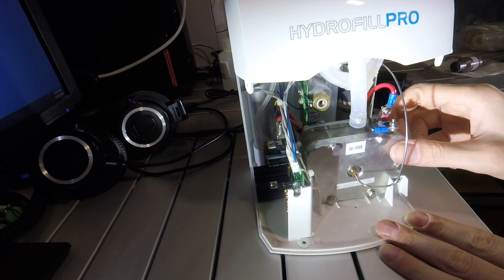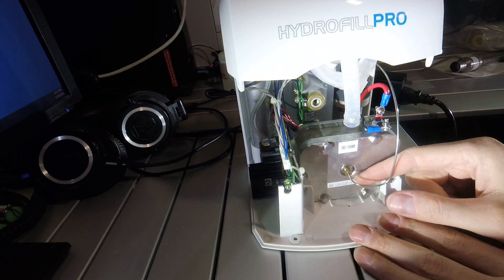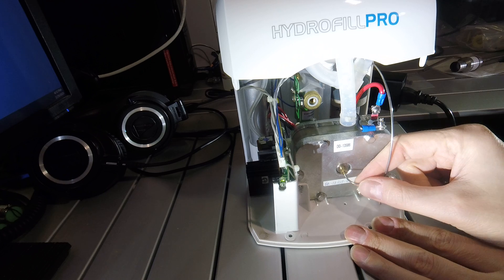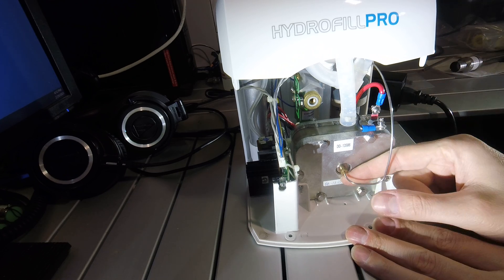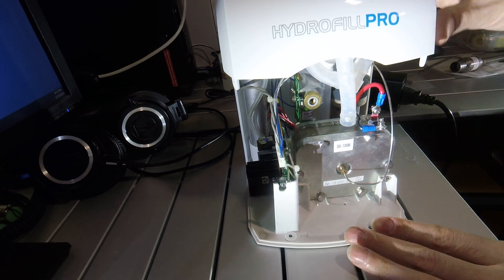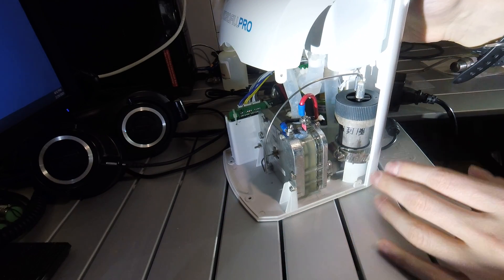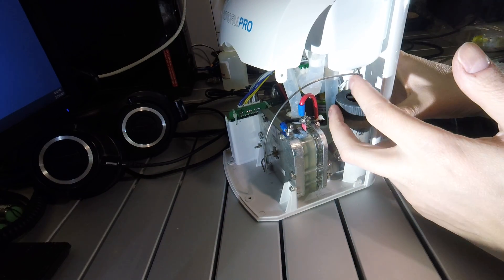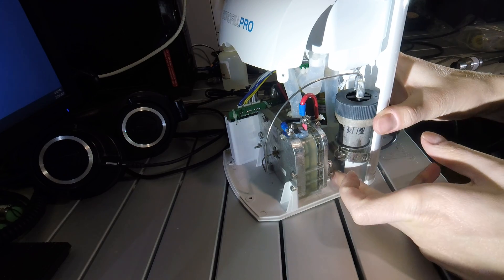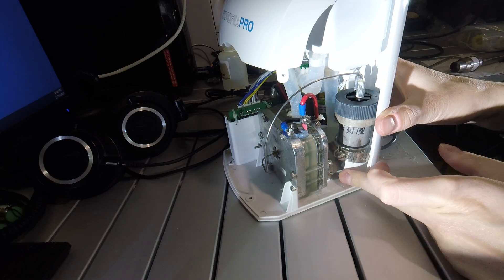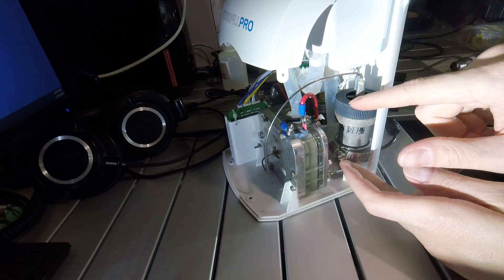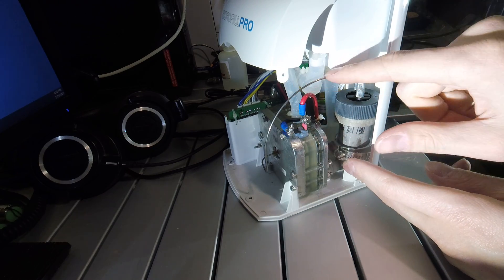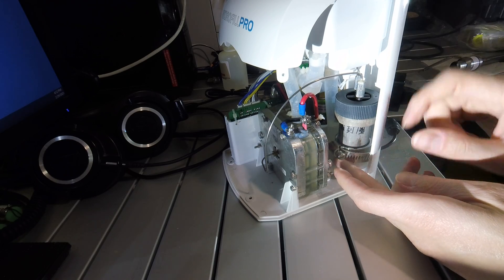So on the hydrogen side of the fuel cell, there is just a small narrow 16th inch OD stainless line which comes out. This is feeding hydrogen. This goes into a water separator tank. It has a hydrogen line in, a hydrogen line out, and a drain line at the very bottom. So any humidity and water that comes out in this hydrogen line is captured in this tank.